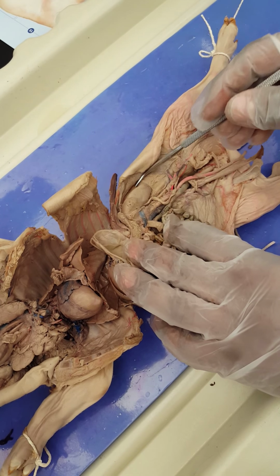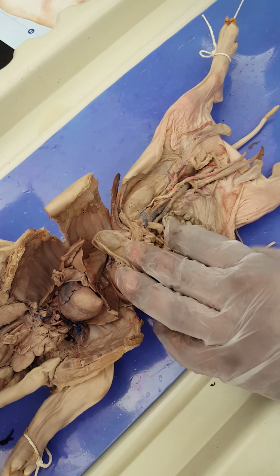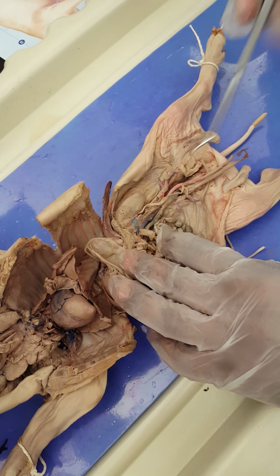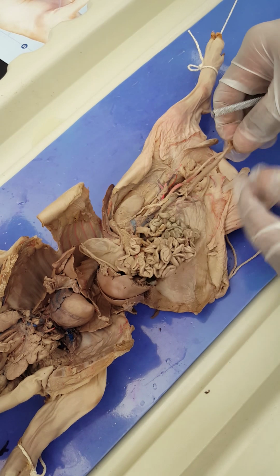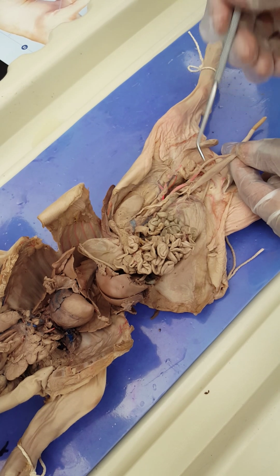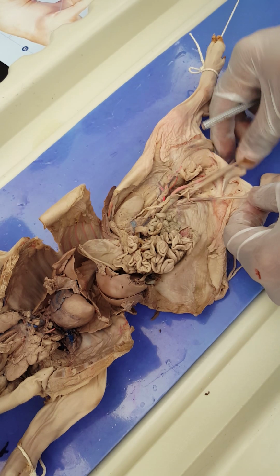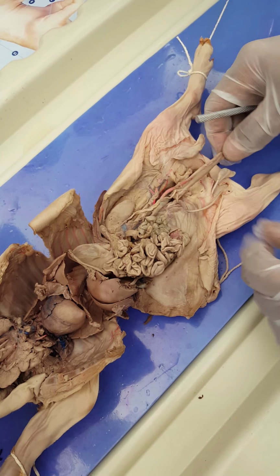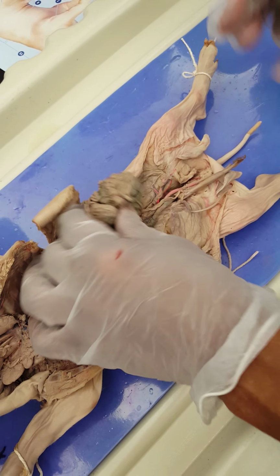You're gonna see one of the kidneys. This is the ureter, and I cut here. It passes urine from the kidneys to the bladder. This is the bladder here, and these are the two umbilical arteries. Sorry, two umbilical arteries and the bladder. If you see the ureter connects to the bladder, it's more obvious on this side here.